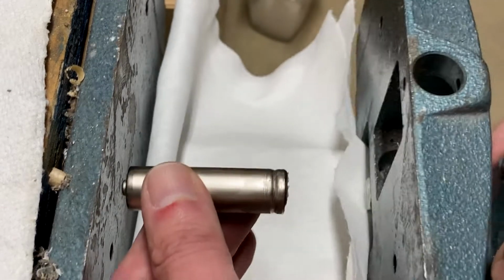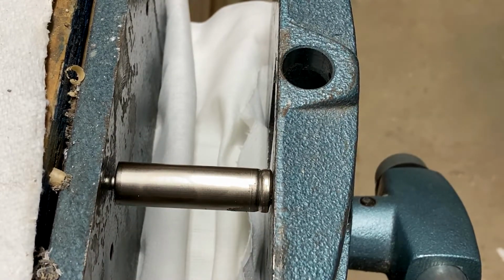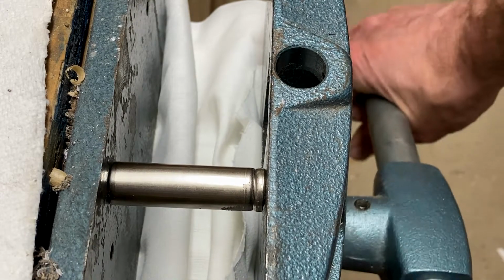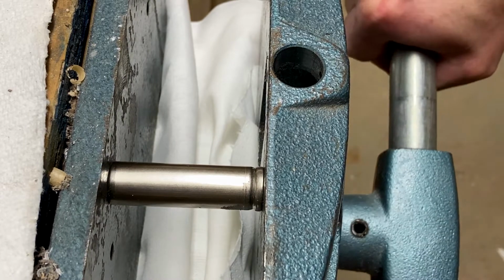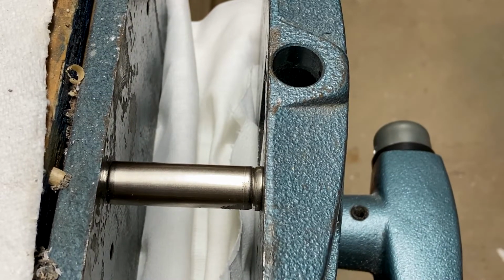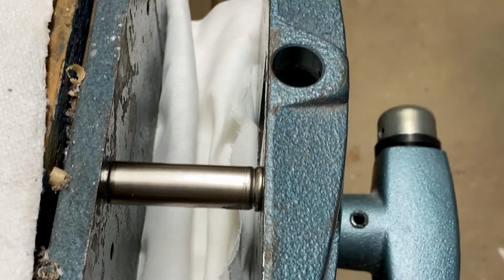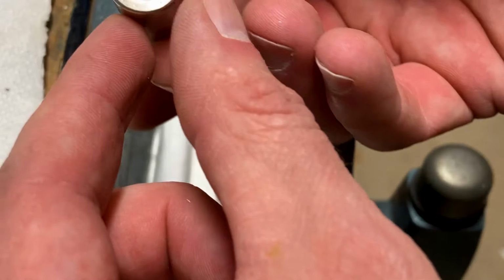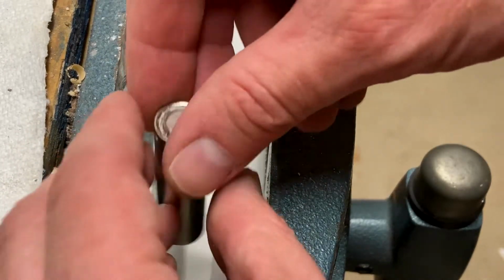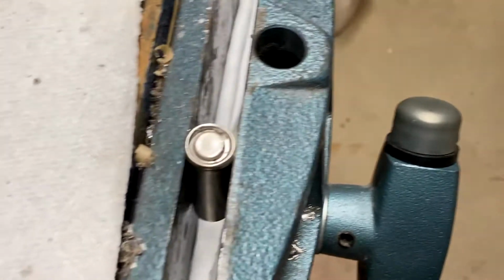open. So what I'm going to try to do here is to see what happens with a battery versus a vise. Hopefully this will be a not too messy approach. I say hopefully. That's not actually as easy as it seems. But let's see whether that actually did anything for us. I'll certainly push that in, but I don't know if that did that much else. So I think what I'm going to try to do is to just squeeze it down more like this. We'll see whether or not that makes a difference.